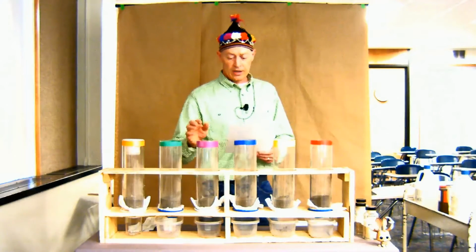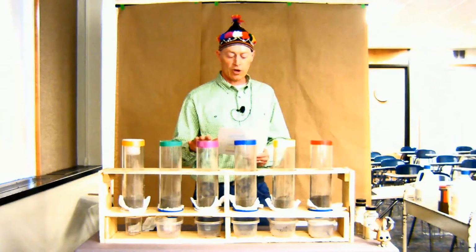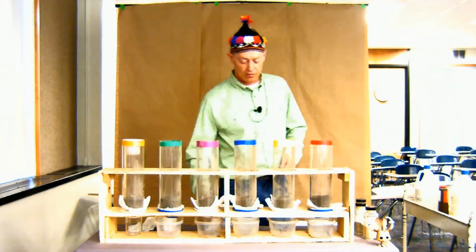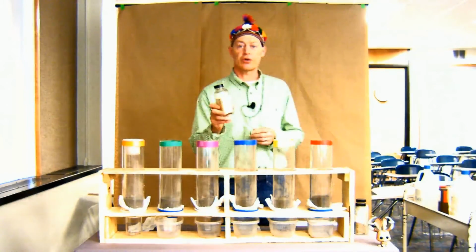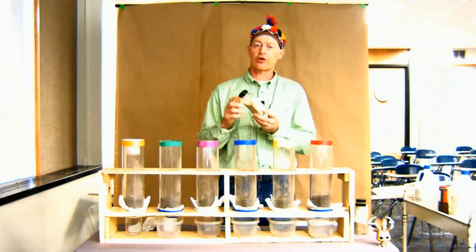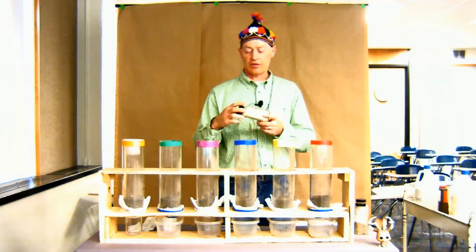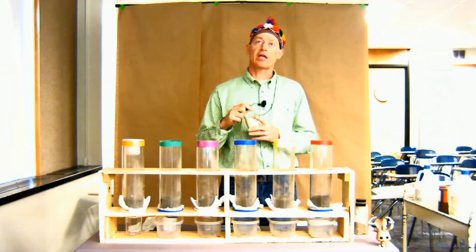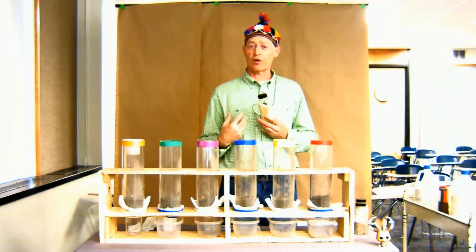The purple one is high SAR, low EC, same soil, but this one we're adding 10 tons of flue gas gypsum. And flue gas gypsum is a byproduct from the coal combustion industry. In North Dakota, we have one plant that produces this, and it's the Leland Olds plant. Back in 1990, through the Clean Air Act, power plants were required to strip the sulfur out.